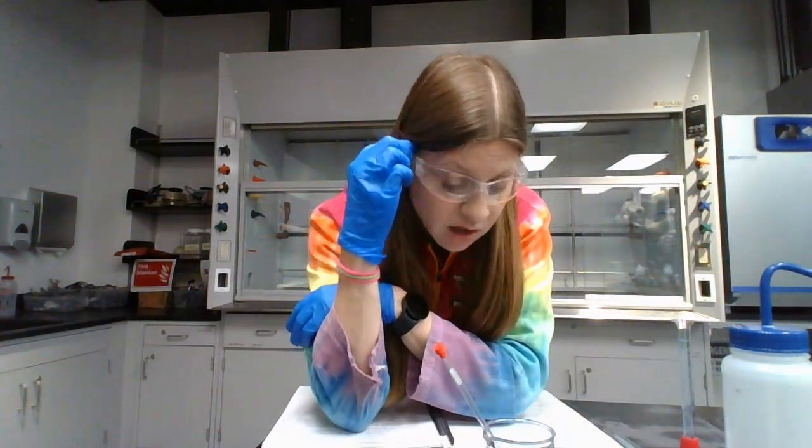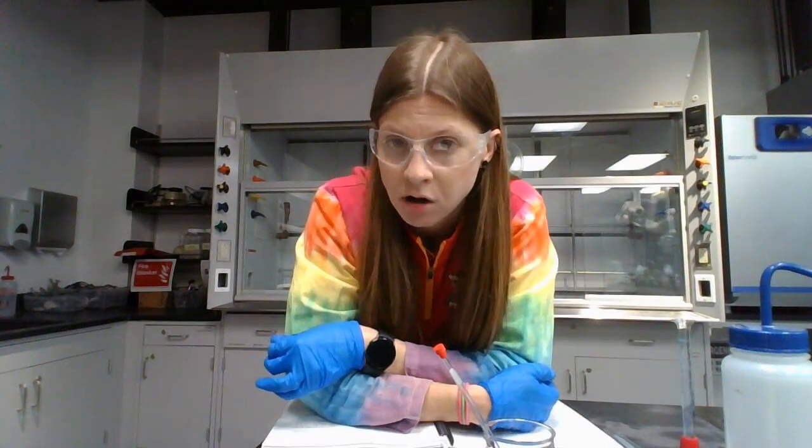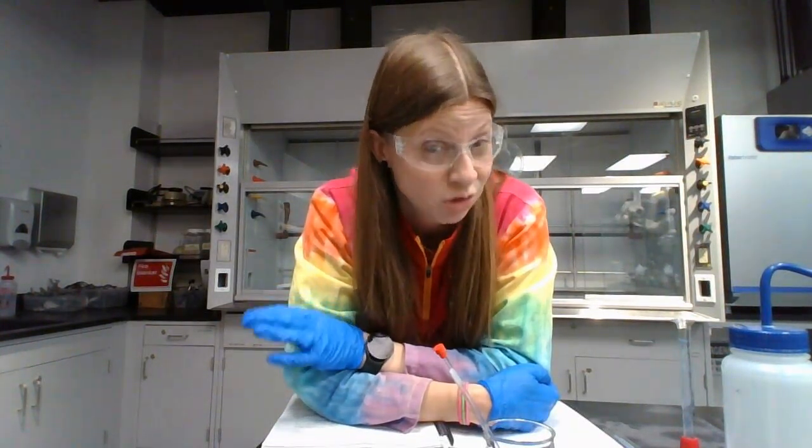So then you'll have either 3 total NMR tubes, 2 standards and a food, or 4, 3 standards and a food. Okay. At this point, you and your partner can go put your name on the board because you will be ready to use the NMR. You're not done with the entire lab, but your NMR tubes are all ready. So there's only one NMR, and so the groups have to go back, and this is like your group of 2. Okay, so you and your partner made your 3 or 4 NMR tubes, and you'll test those. Your partner group made their 3 or 4 NMR tubes, and they will test those.